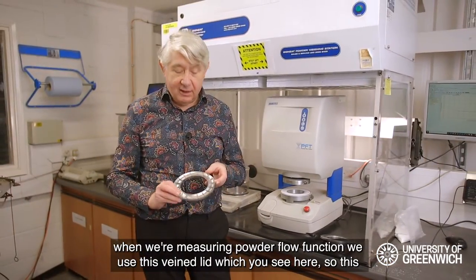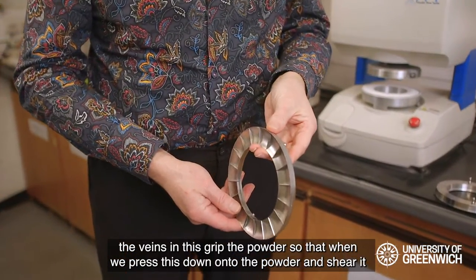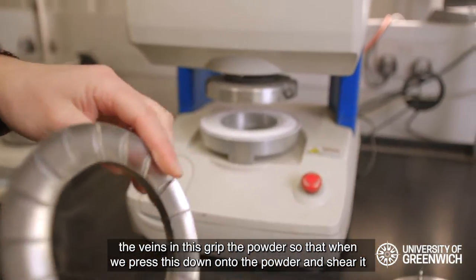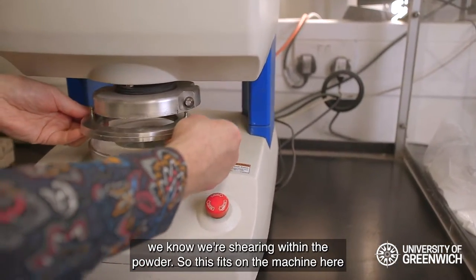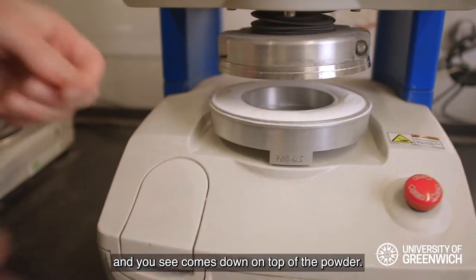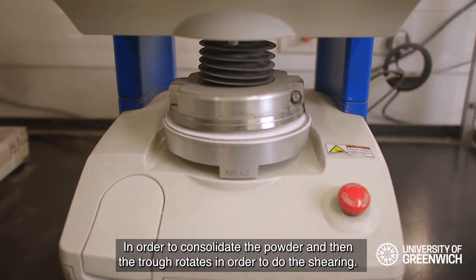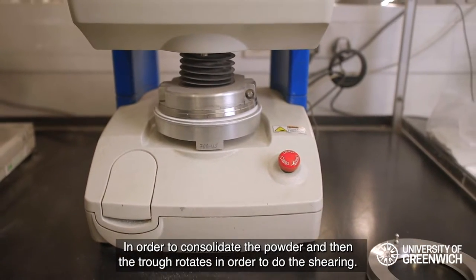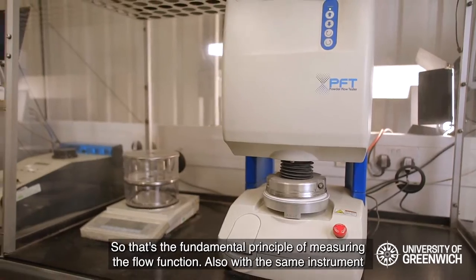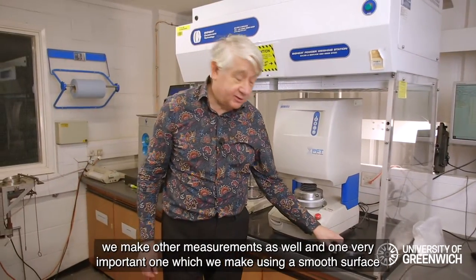The way this instrument works is we place a powder sample in the test cell here. When measuring powder flow function, we use this vane lid, which you see here. The vanes grip the powder so that when we press this down onto the powder and shear it, we know we're shearing within the powder. This fits on the machine, comes down on top of the powder to consolidate it, and then the trough rotates to perform the shearing.